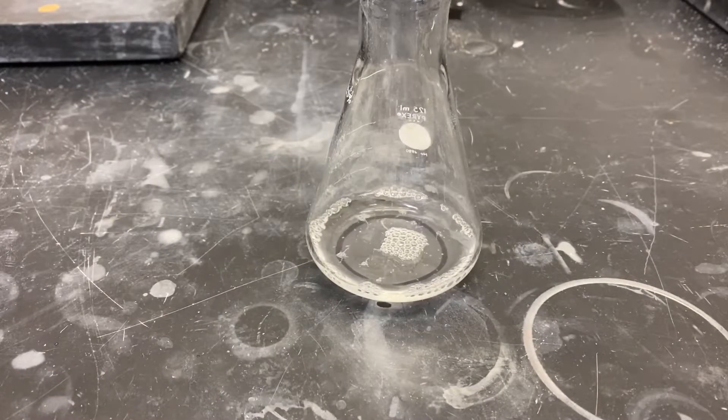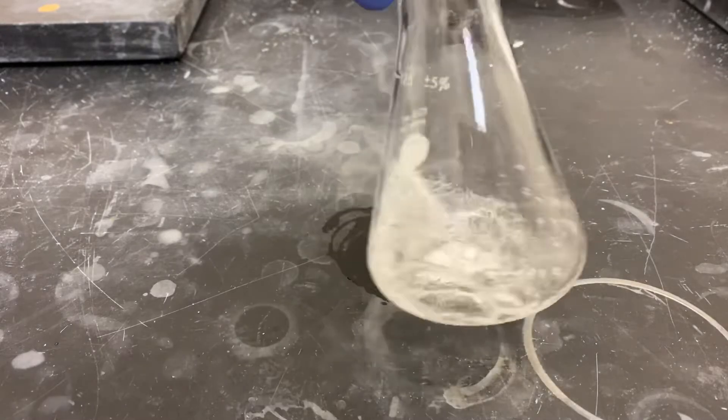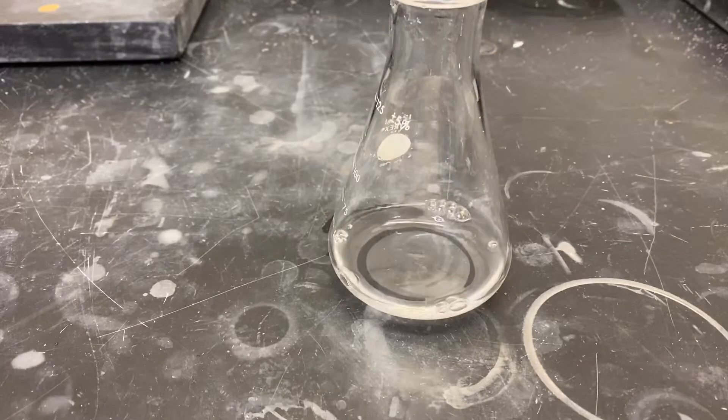After around 30 minutes of reaction time, the mixture became a clear solution. The reaction is done when there are no solids left in the mixture.